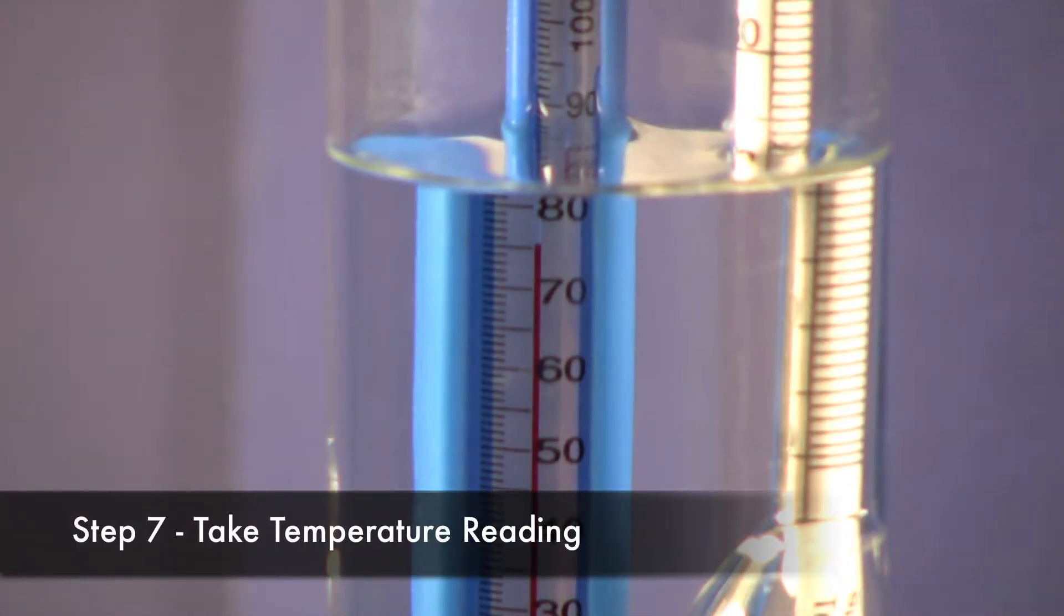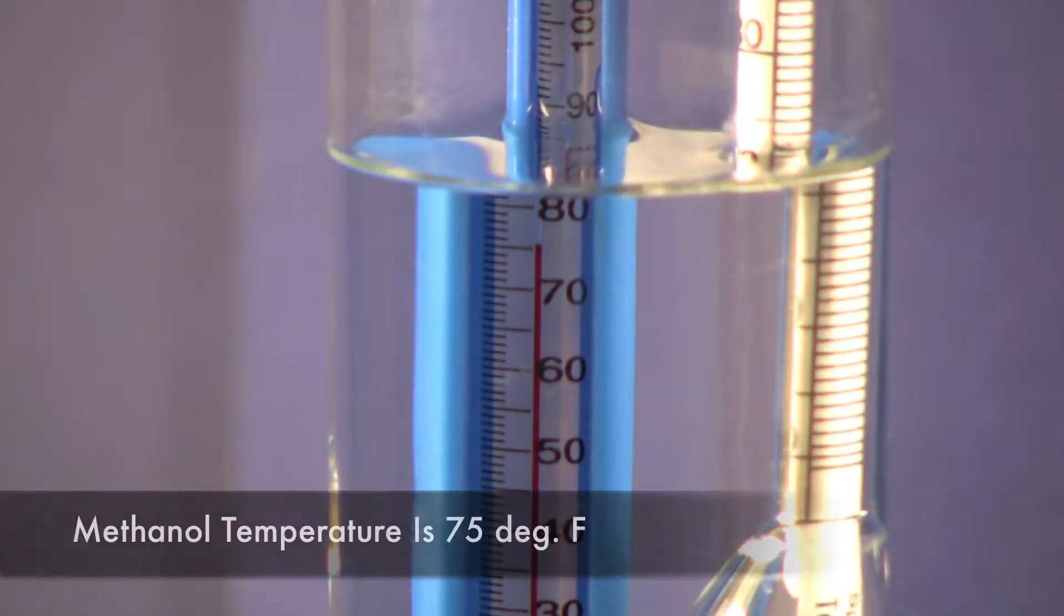We've let this sit for a while. And we're sitting right at about 75 degrees Fahrenheit. So that's the number that we'll use.